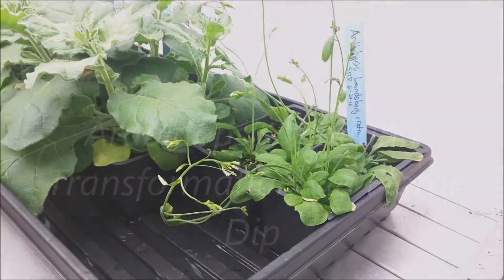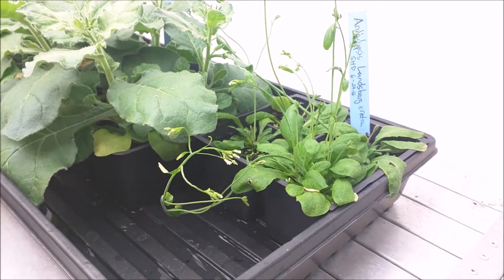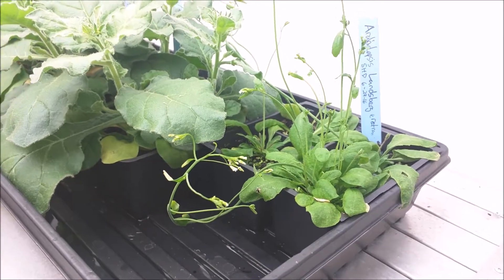This is the model plant, Arabidopsis thaliana. Here I have it growing in a chamber with another model organism.